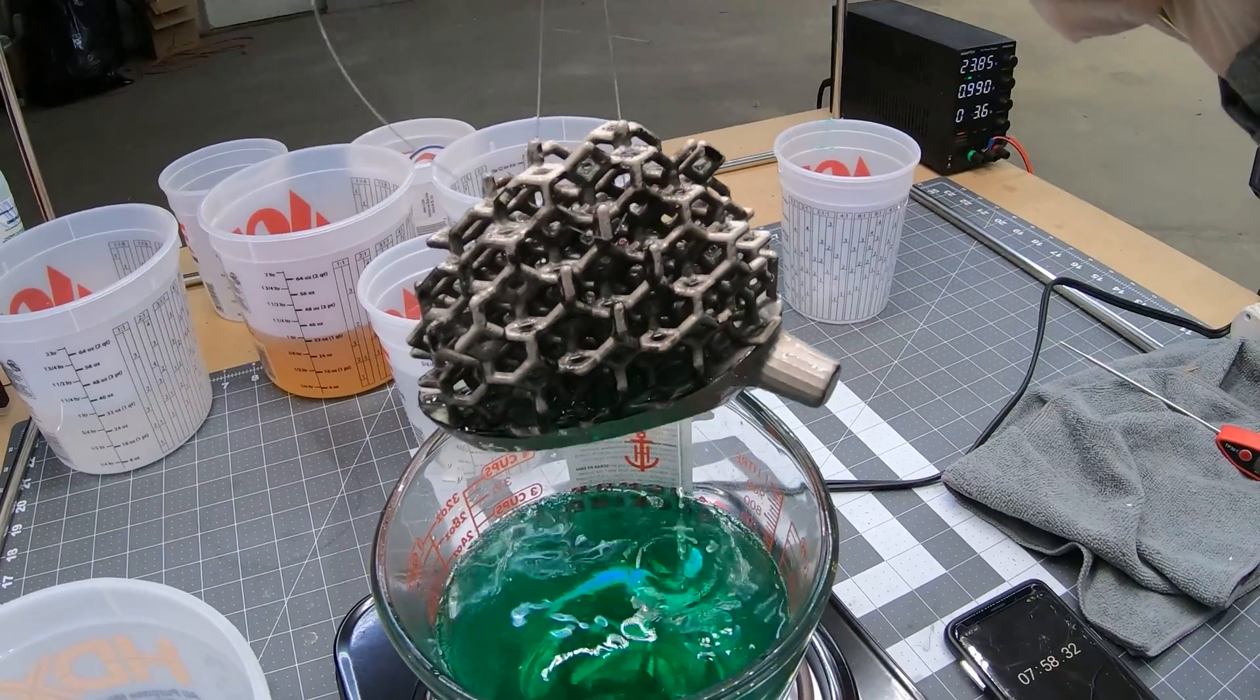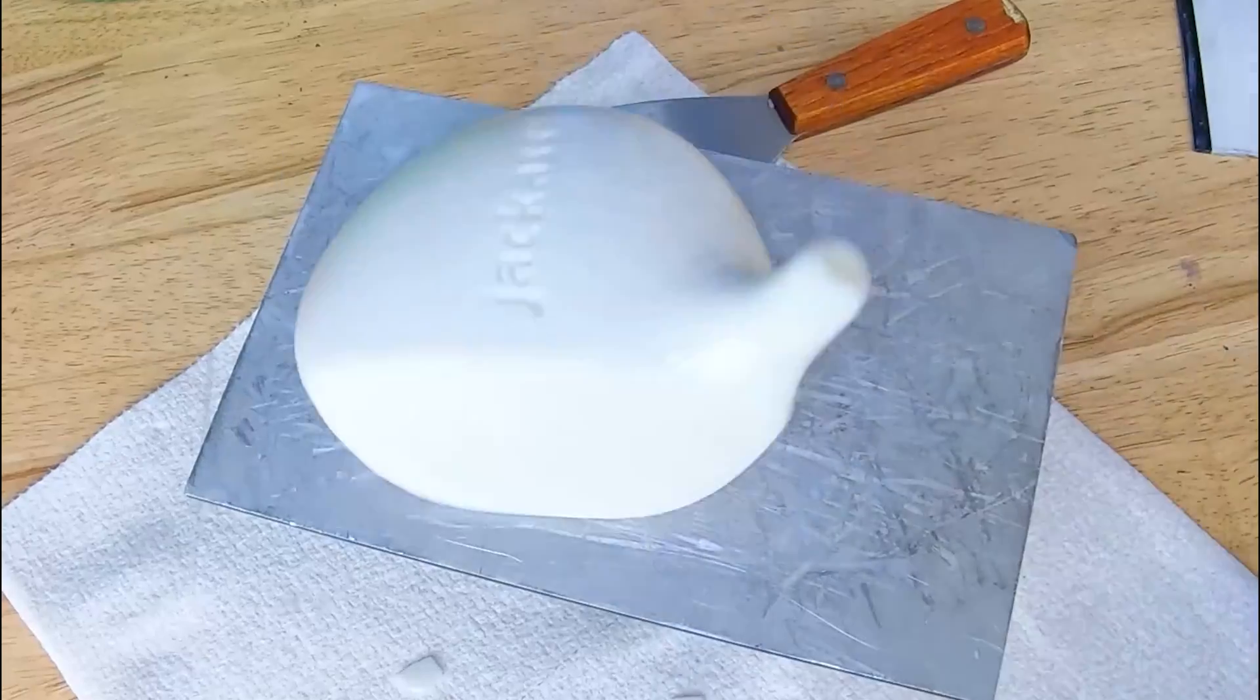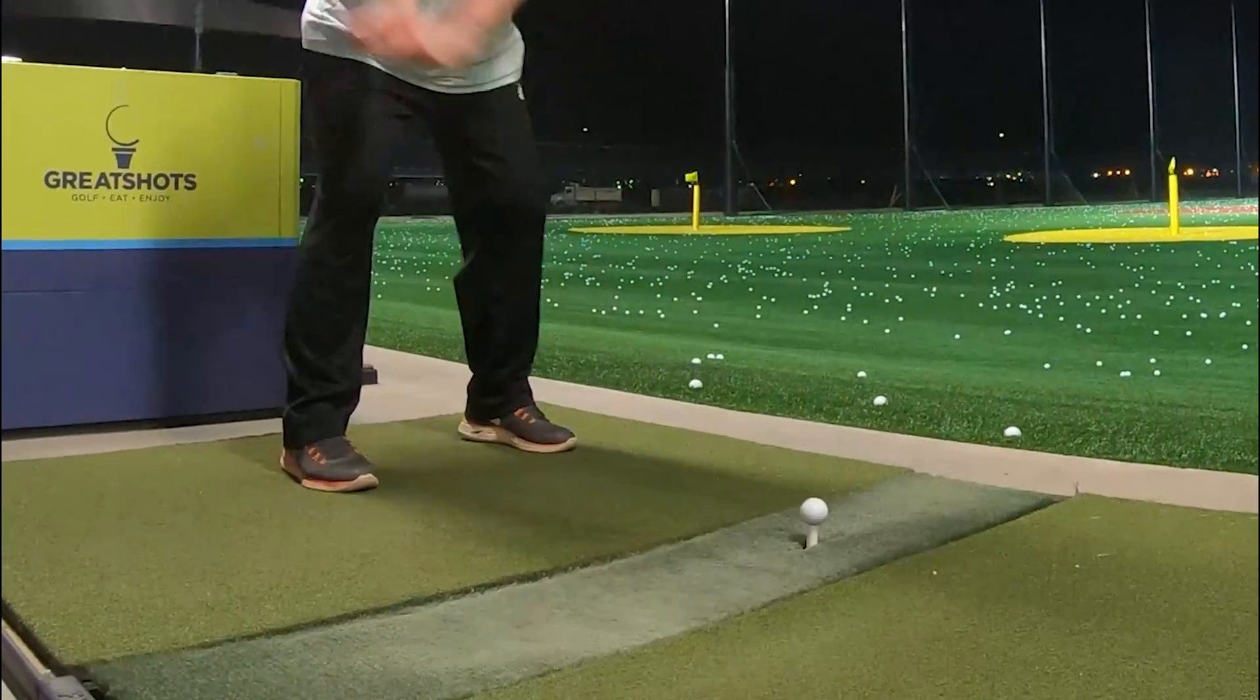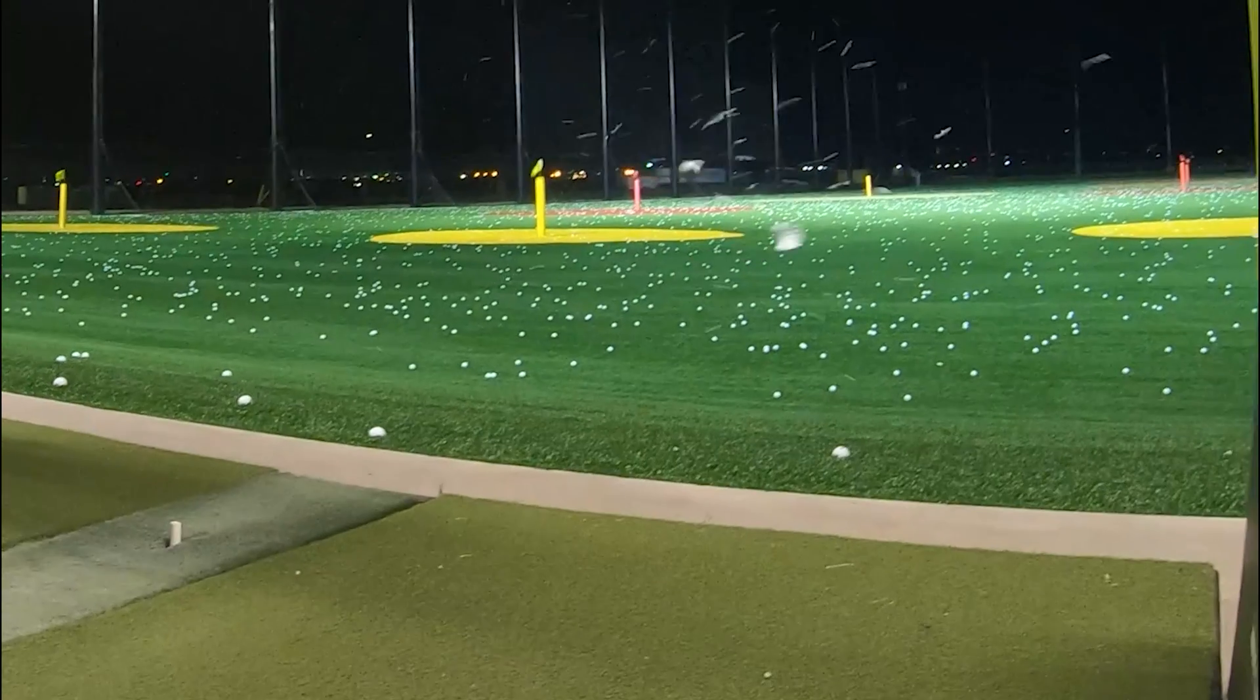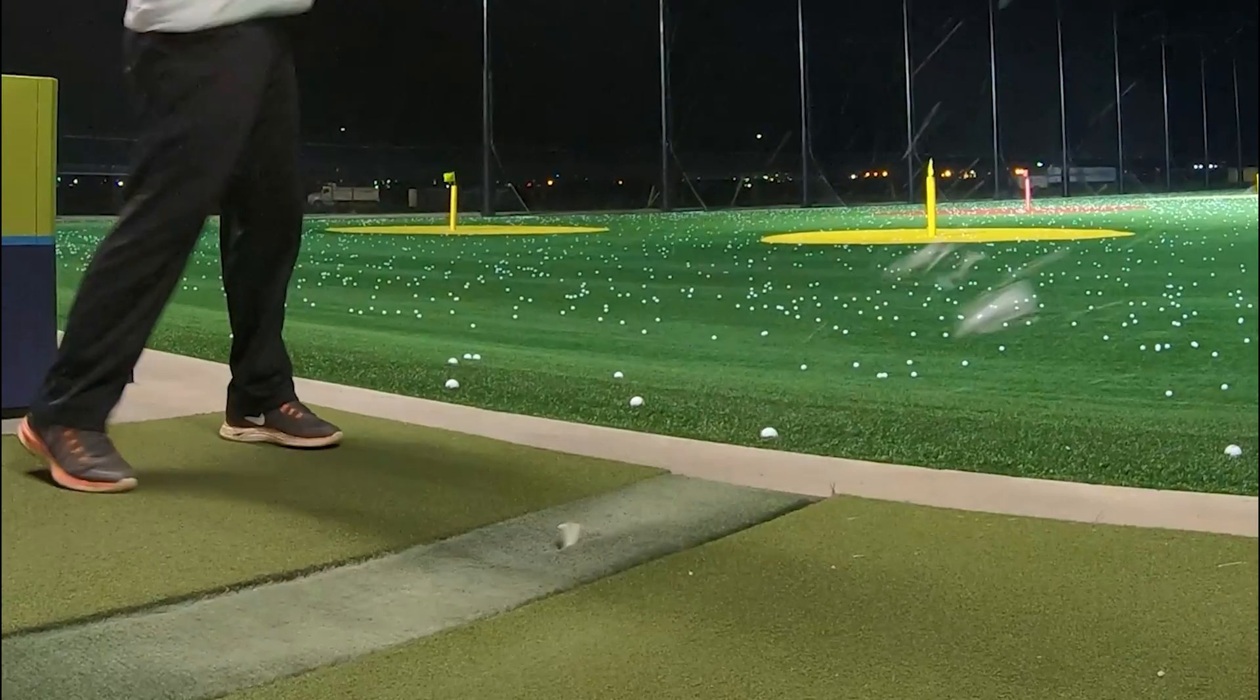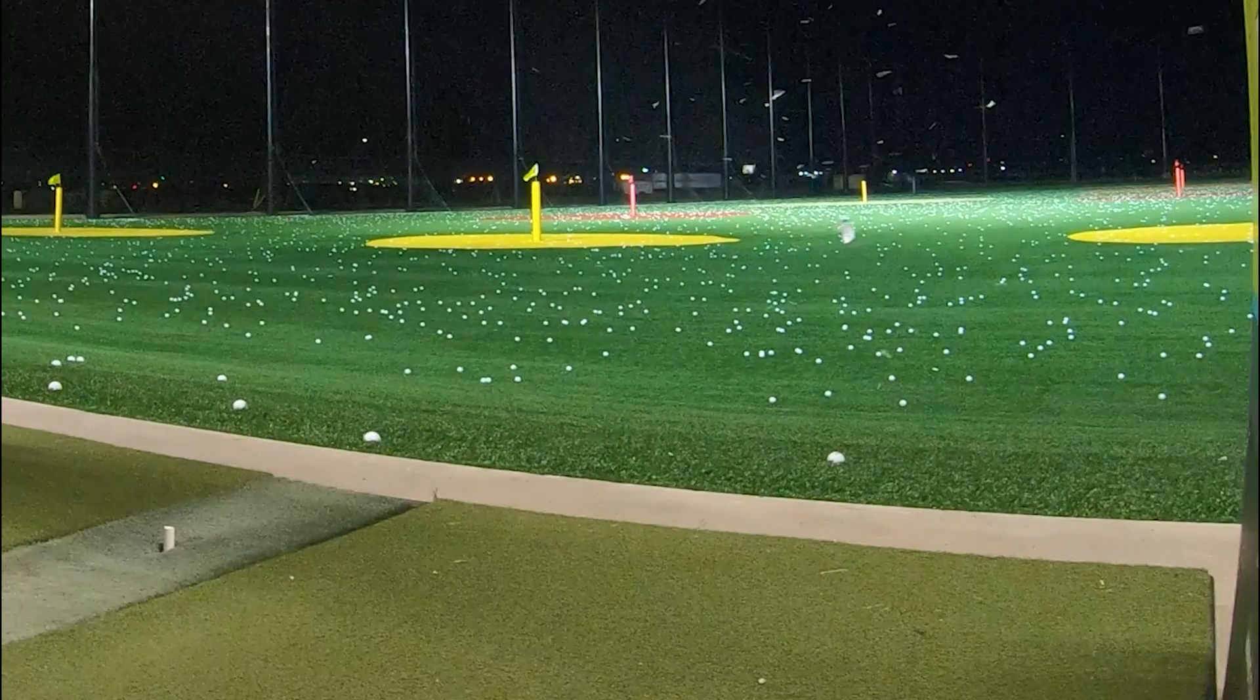When I found out that this was possible, I immediately got excited because last year I resin printed a golf driver head to see if it would work and totally exploded it over the driving range. So I thought to myself, if I can somehow coat a golf driver in metal, it might make it way stronger so it won't explode like last time.